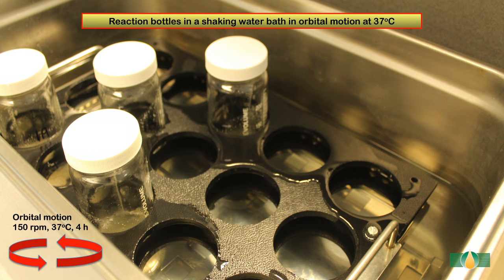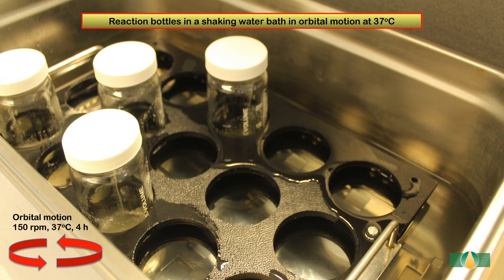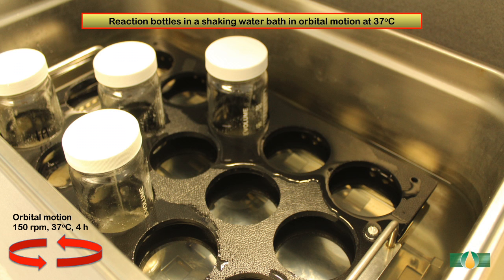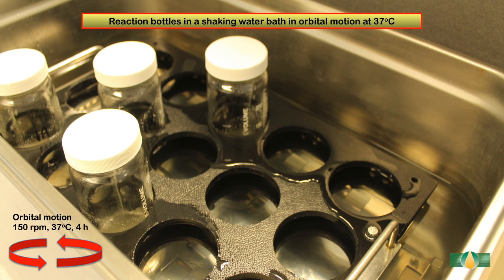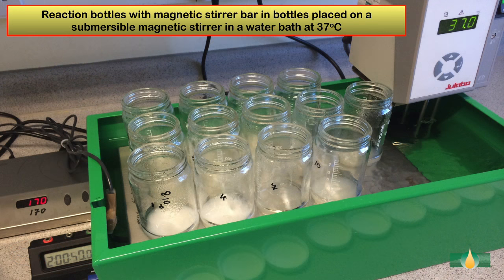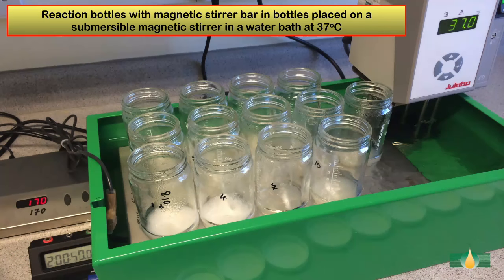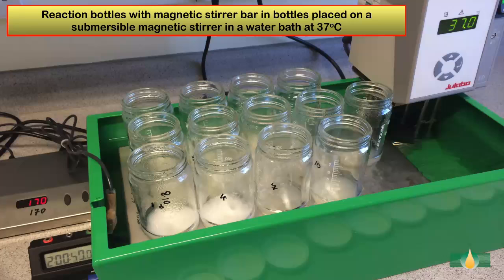The incubation of sample with pancreatic alpha-amylase and amyloglucosidase must be performed in a situation where the sample is suspended during the incubation. This can be performed in a shaking water bath with polypropylene inserts to hold the bottle steady during the shaking process. Alternatively, the samples can be suspended during the incubation using a submersible magnetic stirrer.